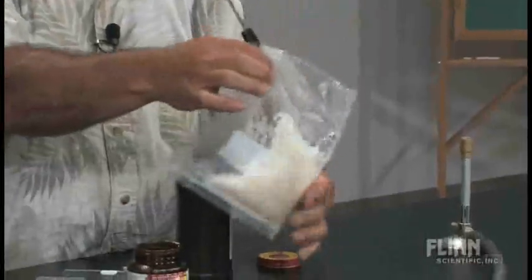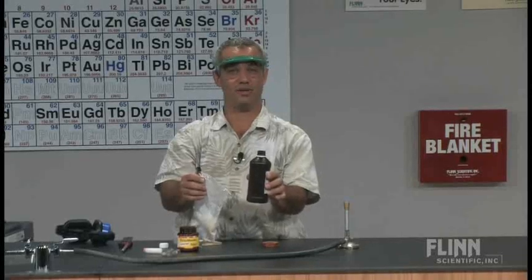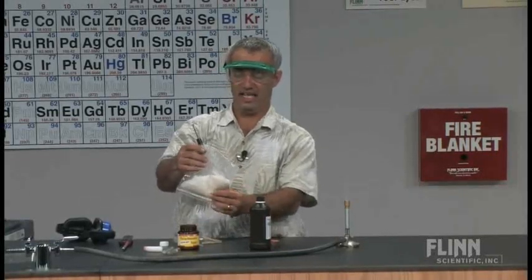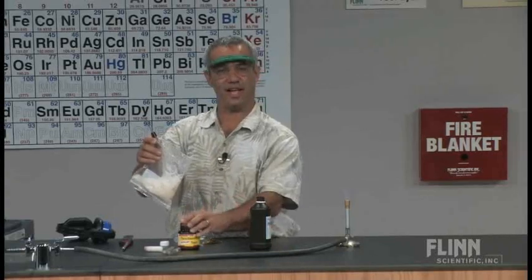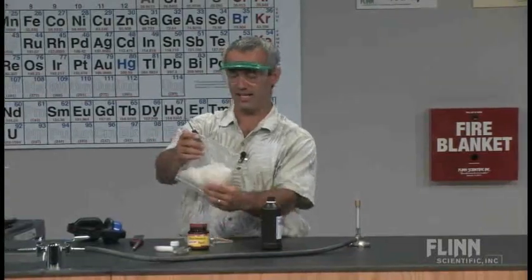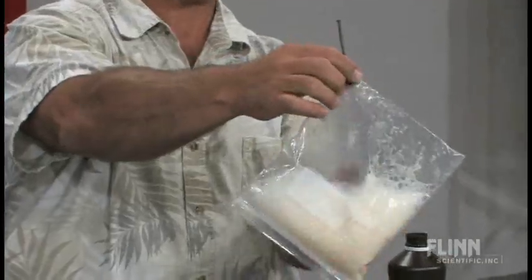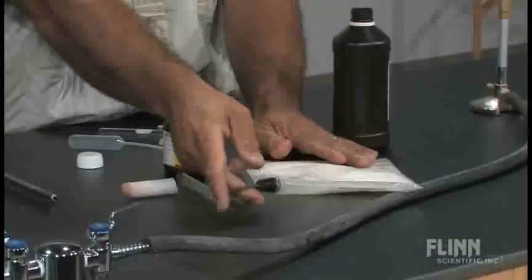That reaction is the hydrogen peroxide decomposing into water and oxygen gas. The yeast is serving as a catalyst — lots of things can be used to catalyze that, yeast is just something fairly available. I'm getting oxygen gas in there which I'm going to use in a second.